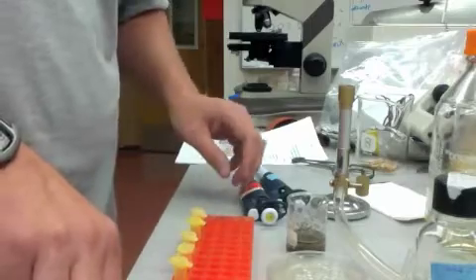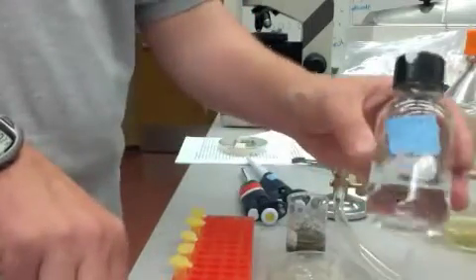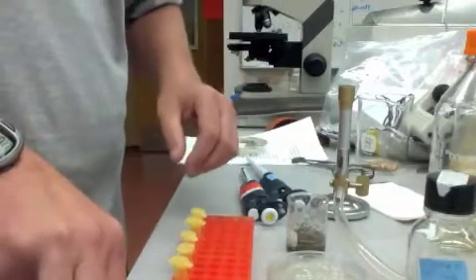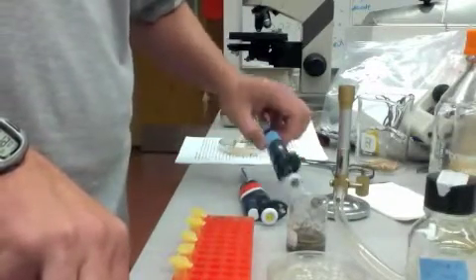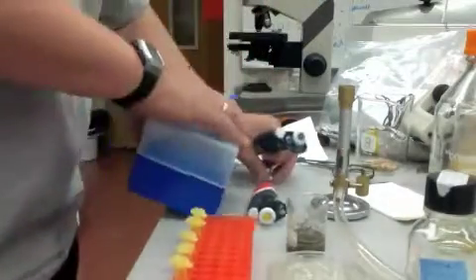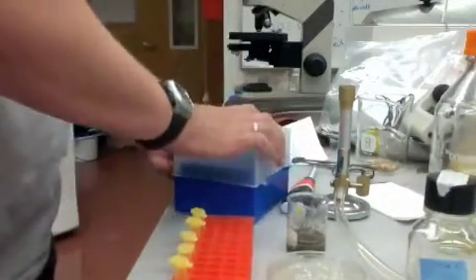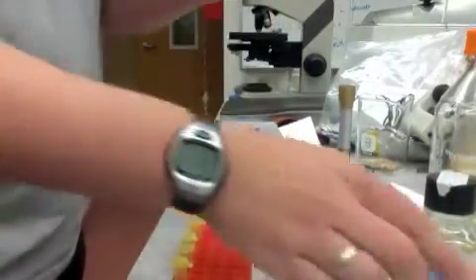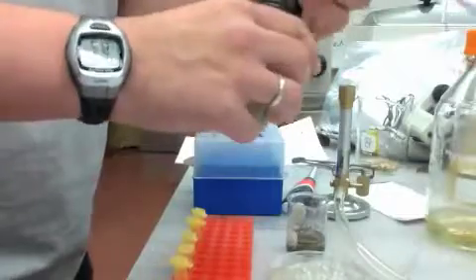So the first thing I'm going to do is put my diluent in a series of these tubes to begin my dilutions. And this is pretty simple. You've got to use sterile technique.